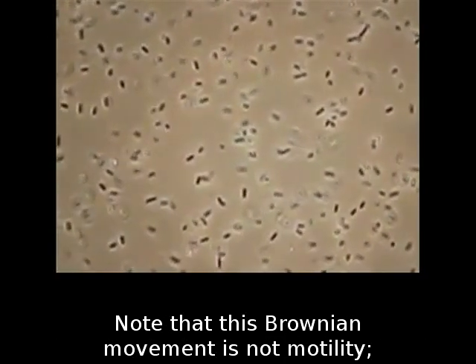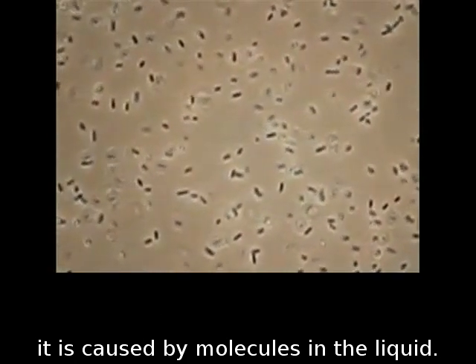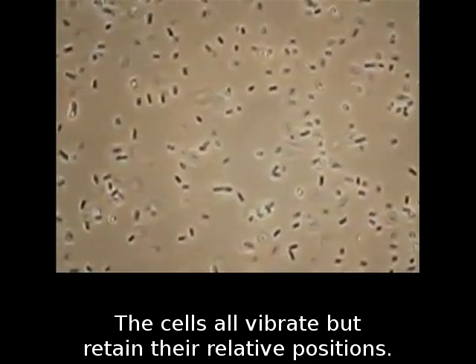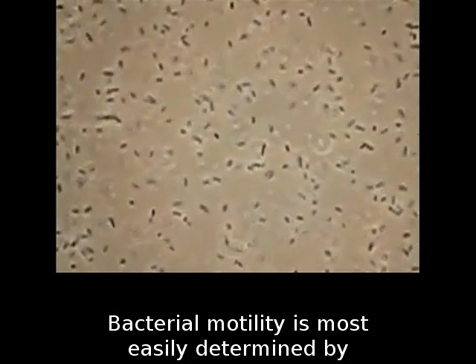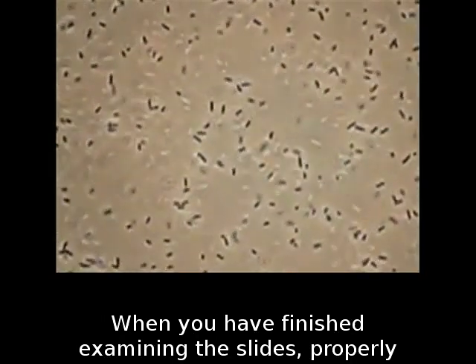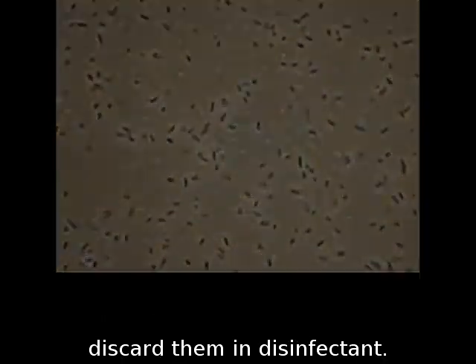Note that this Brownian movement is not motility. It is caused by molecules in the liquid. The cells all vibrate but retain their relative positions. Bacterial motility is most easily determined by observing moving cells in a wet mount. When you have finished examining the slides, properly discard them in disinfectant.